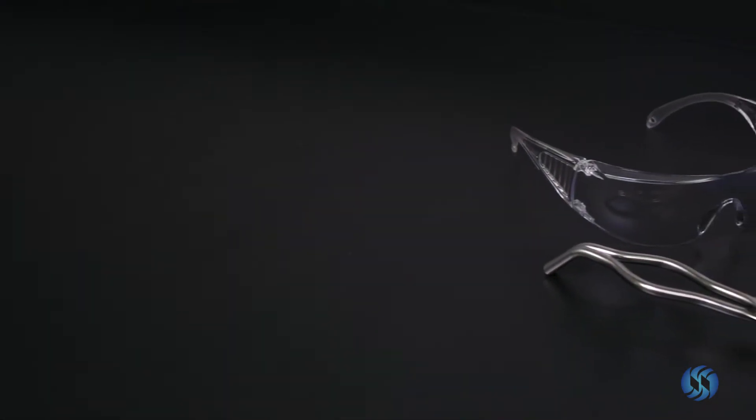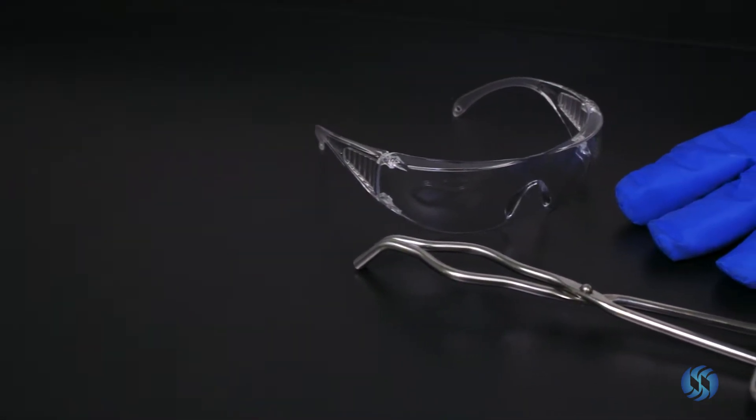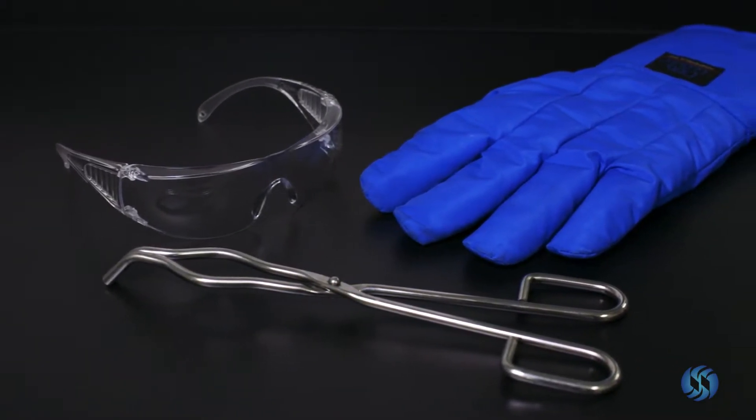Prior to cryo-milling, please adhere to proper safety procedures. Wear safety glasses and avoid contact with liquid nitrogen.